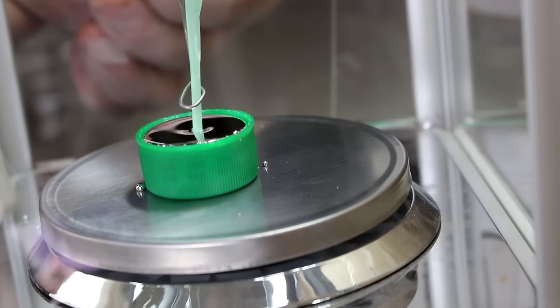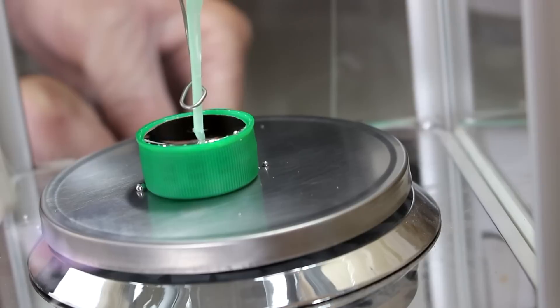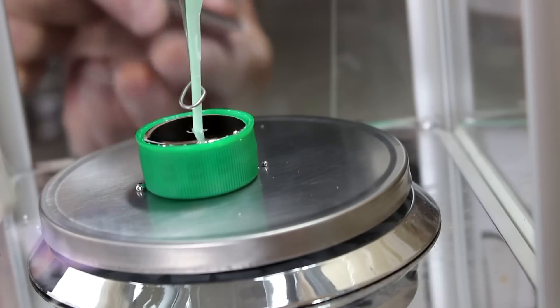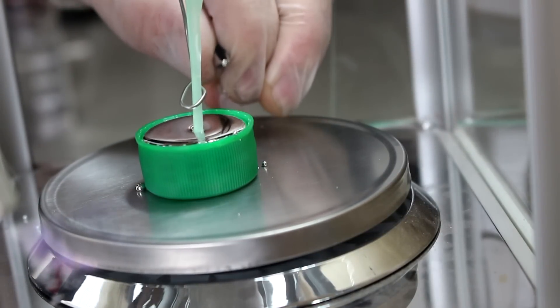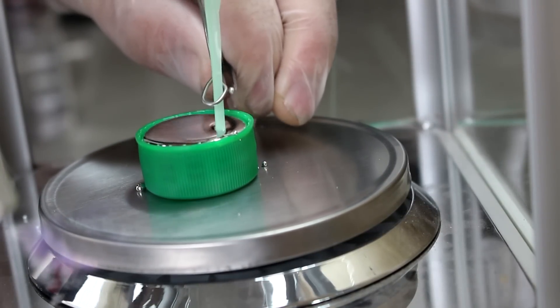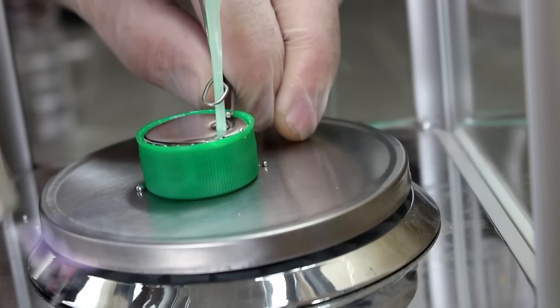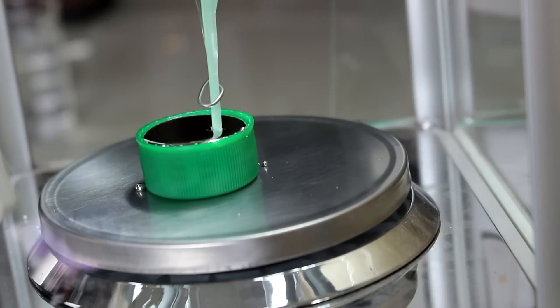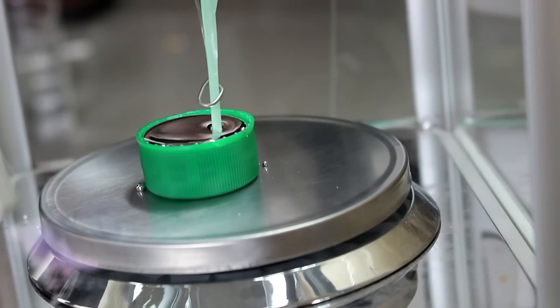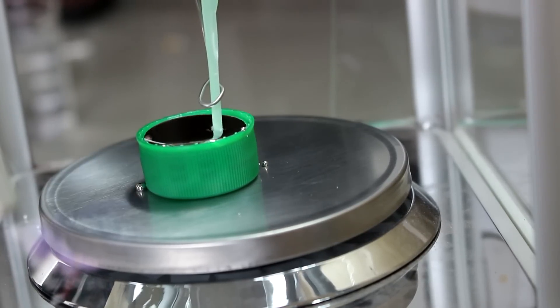Now I'm going to drop the platinum and I'm going to pick it back up. I'm going to bring it over here and stick it onto the little pad that I put it. Did that catch it? I think we got it.